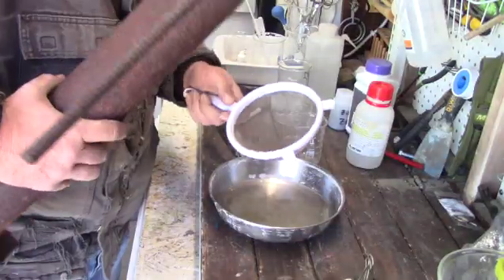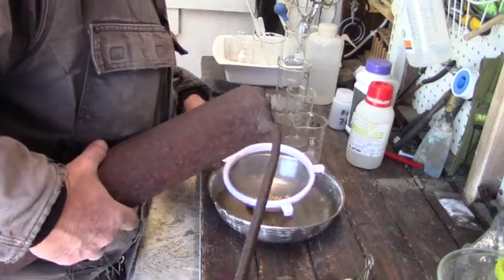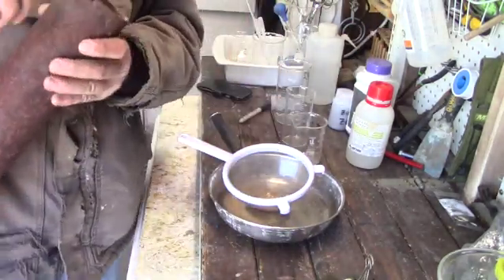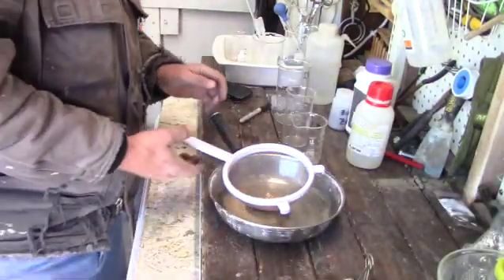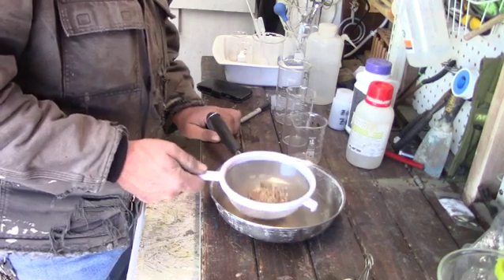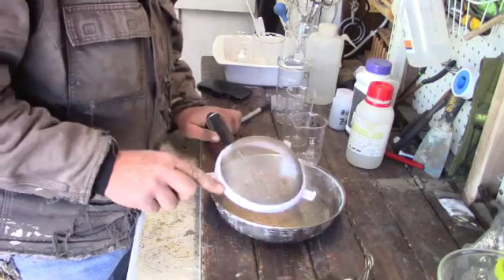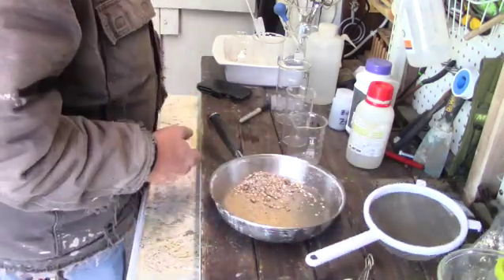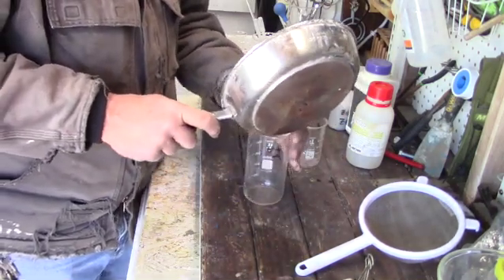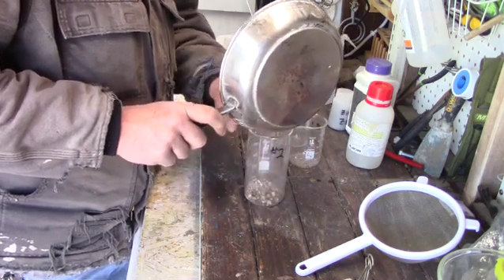Well, I've taken this rock outside and crushed it up. We're going to screen it out here — no dance crushing today, not in the mood. We're going to screen this out just to see if we got any nuggets in there. I really doubt it, but heaven forbid I throw it away and there's a big nugget in there. So we'll just mix this all in as one sample and process it as is.